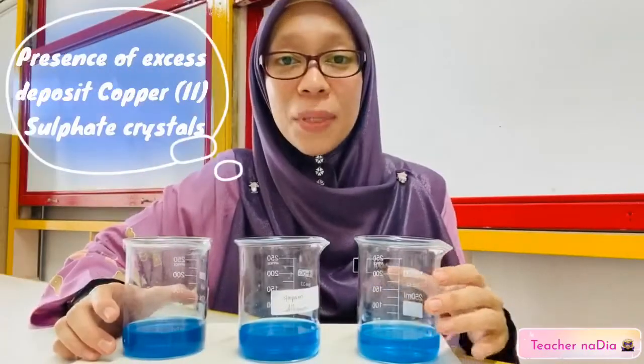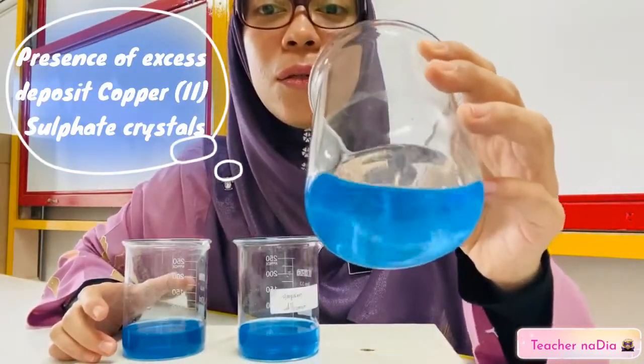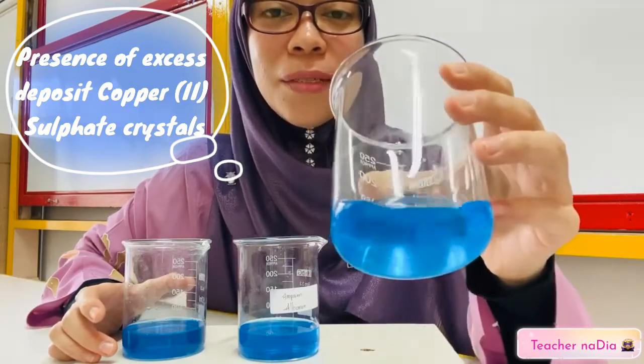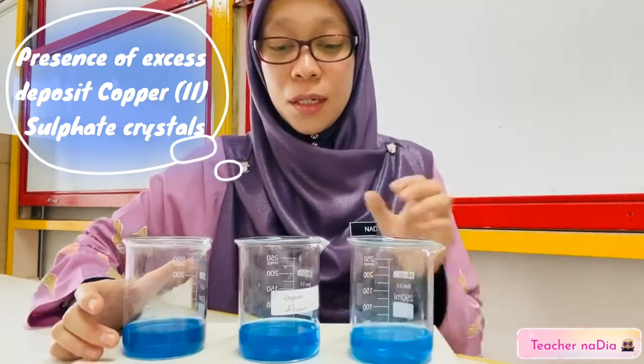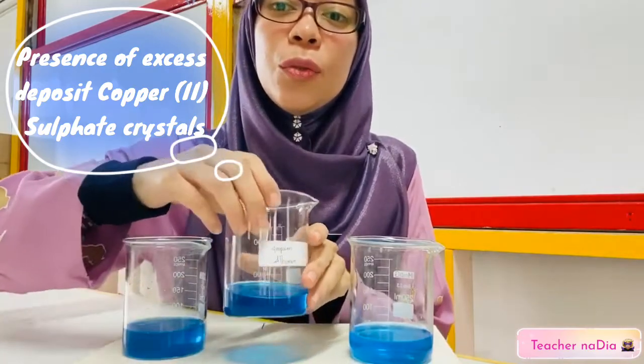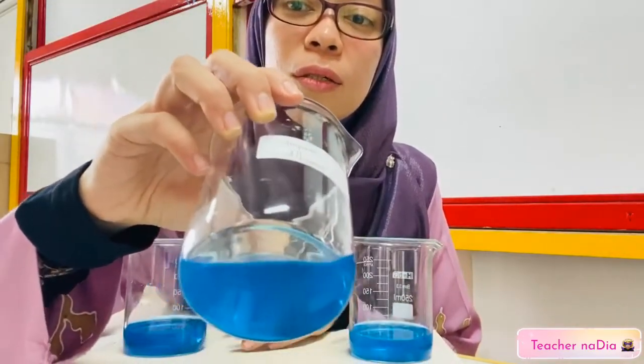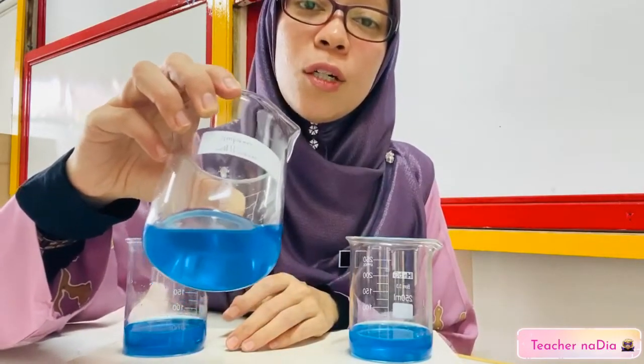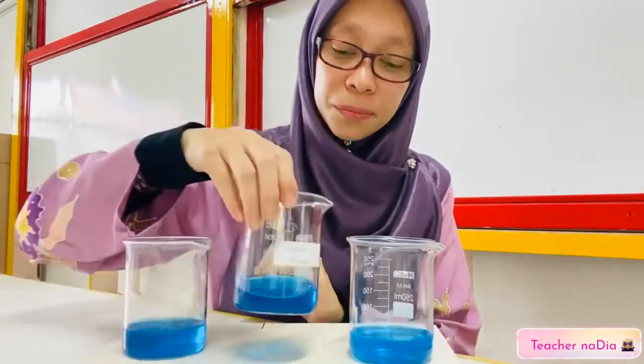For beaker P, if you can see, the solution is clear, right? And then for Q, there is no deposit of excess copper sulfate crystal.